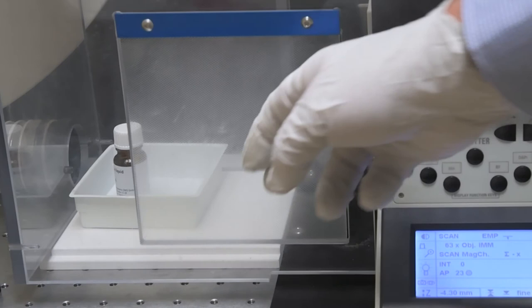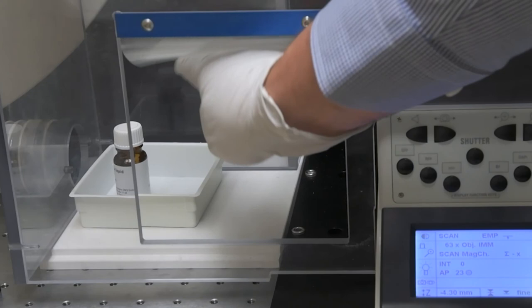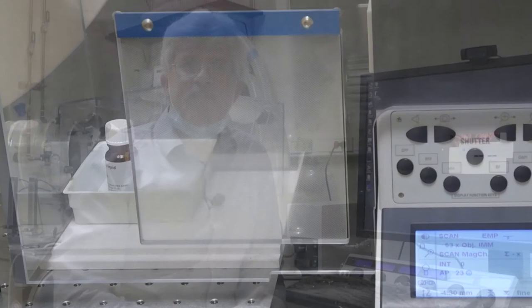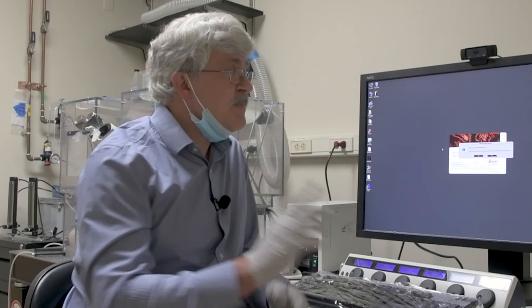The third thing to look for is the oil. Make sure that any oil inside the chamber is out of the way of the stage so it doesn't accidentally get knocked over. Down here on the bottom is where it should be kept. Now that you've checked those it's time to move forward in the software. Remember to tilt back the condenser, lower the objectives, and move the oil out of the way. At this point you can go ahead and hit no to the question of whether or not you want to initialize the stage. Unless you absolutely need it, always hit no.